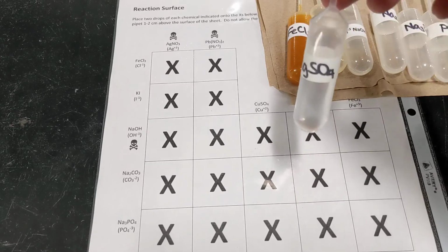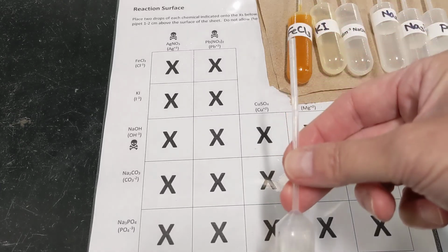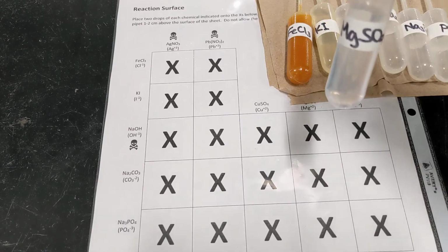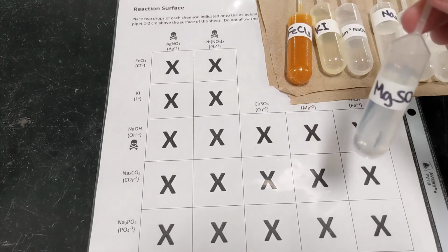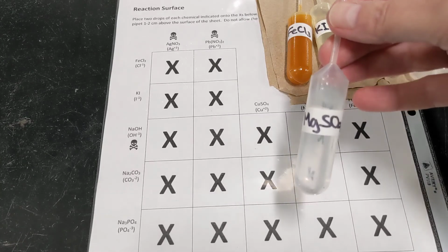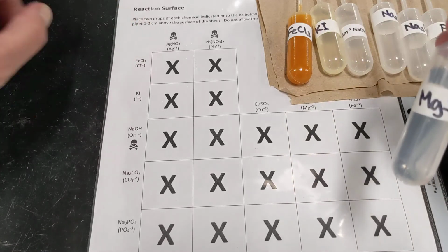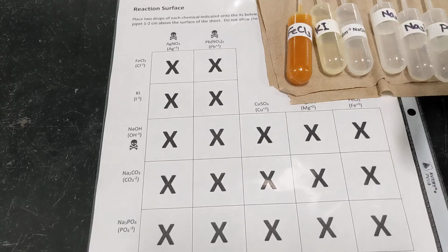And then those solutions I've placed into these little dropper pipettes, and I will be using those to just react a couple of drops of each solution for each reaction. So it saves material, right? And it's safe, especially when we're using things that might not be so good for us.